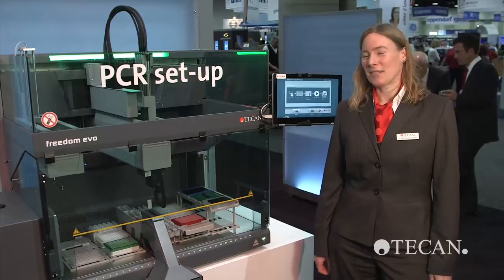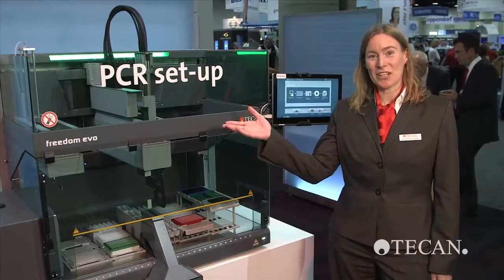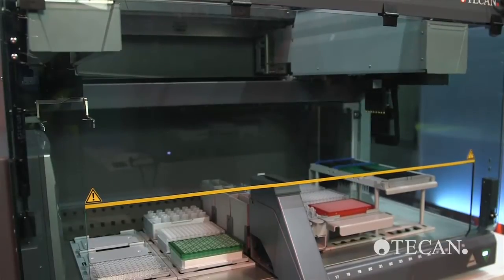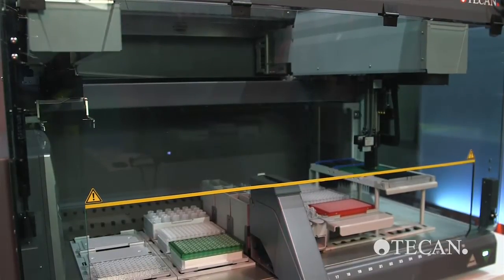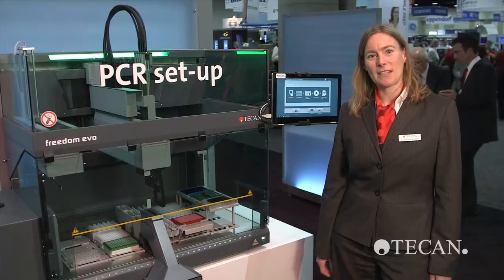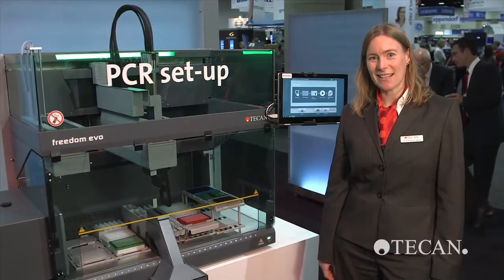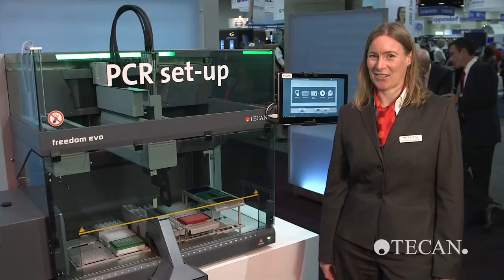We combined the wizard with our best-in-class pipetting workstation, the Freedom Evo, together with an air-displacement pipetting arm. This system can generate multiple PCR plates per run in 96 and 384-well format with outstanding precision and accuracy.